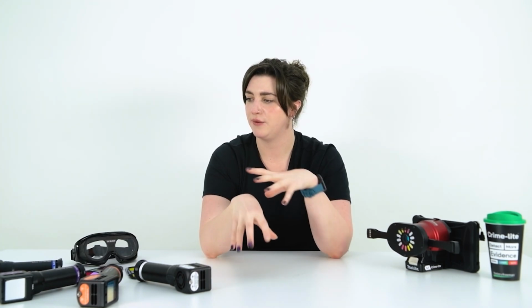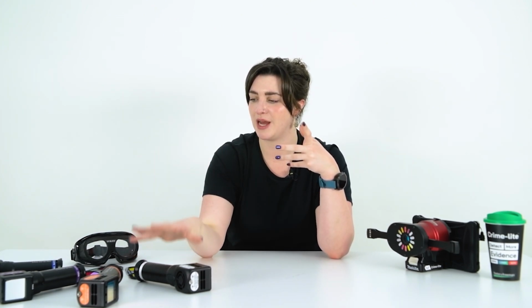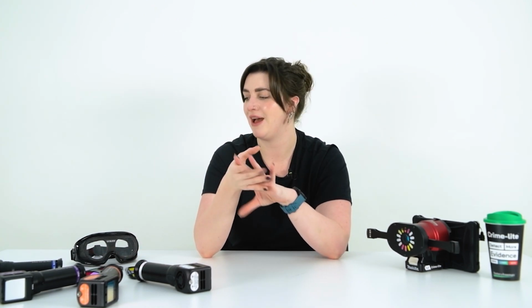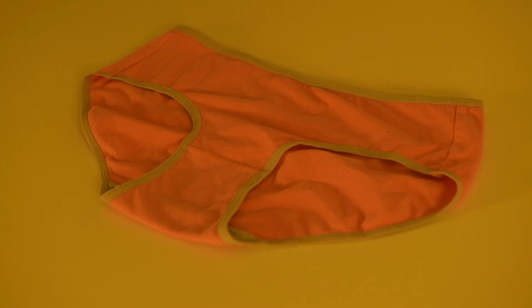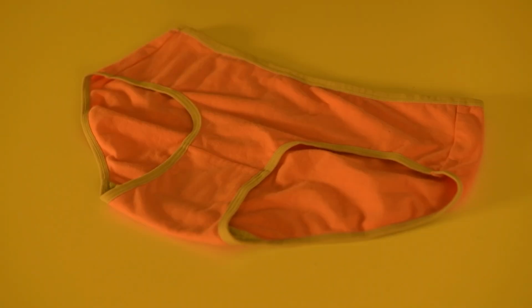So what we will do is take a look at some different fluorescent evidence types using the Crime Light 82 Pros to see what evidence we can find. This surface is a pair of women's underwear, and visibly, there's not really anything of interest. We can see one small area of staining, but what we can do is use a blue light source to see if there is any additional staining also visible.